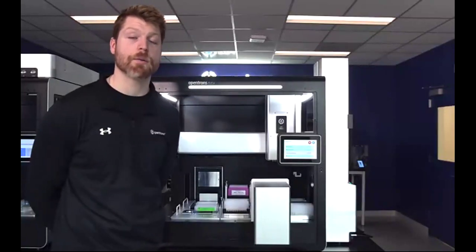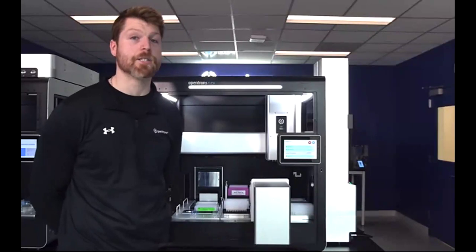And then as a quick note, we do recommend all of these modules, but the workstation is totally modular. That means that you're not tied to this robot doing one specific function or being in one specific configuration. So if you need to scale up your NGS library prep or move away from it in any way, you have the ability to really quickly, with just a couple of screws in most cases, change out any of the pipettes or modules.